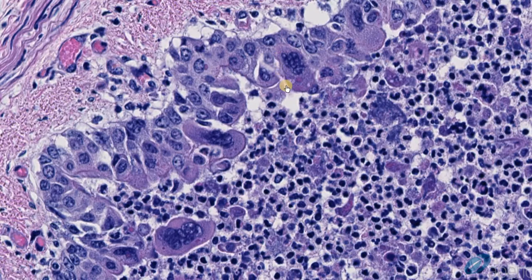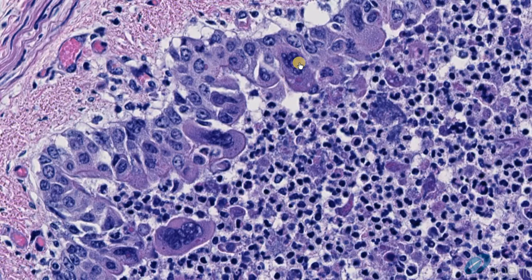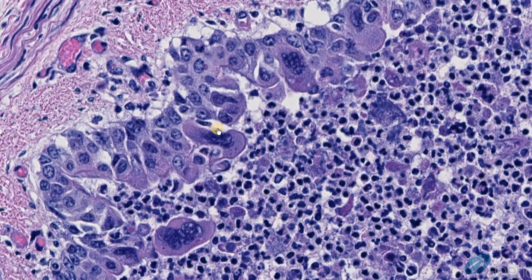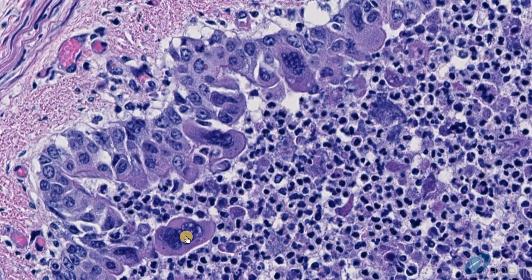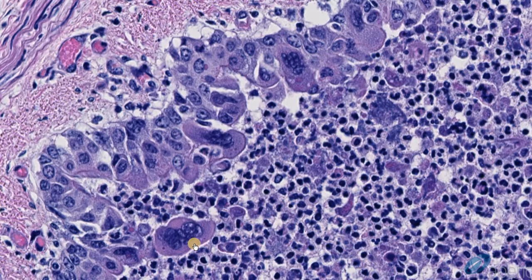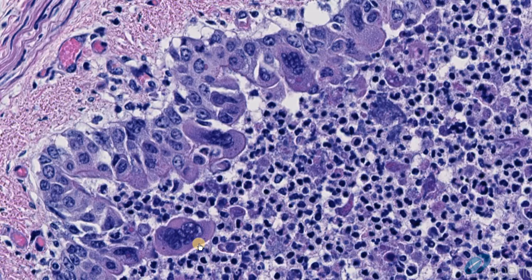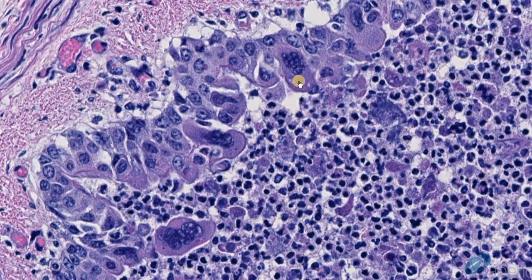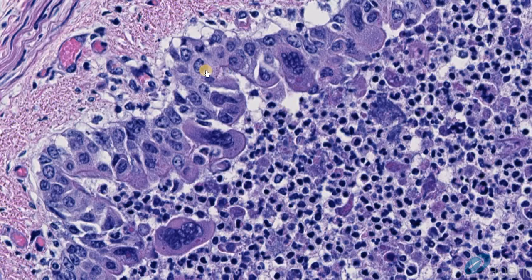We'll frequently see that bronchus epithelium is forming multinucleated syncytial cells — here's an example, here's another example, and here's a third example. And also within these syncytia and other cells, you'll see intracytoplasmic eosinophilic inclusions, as in these examples here.